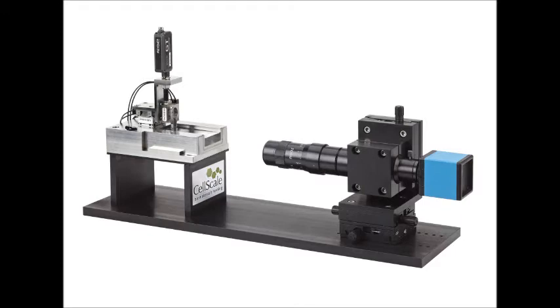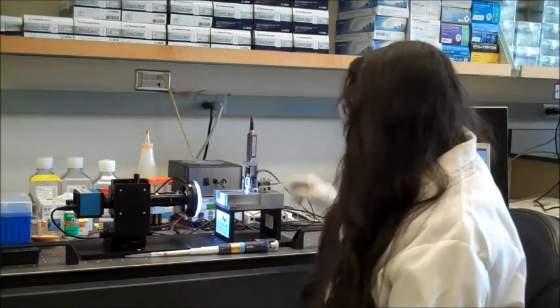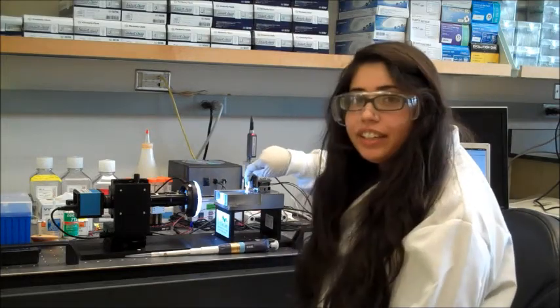I know a lot of researchers do different things with the micro squisher, so I wondered if you could just walk us through a typical test setup for your application. The procedure for setting up the micro squisher for our testing is very simple. Because the micro squisher relies on cantilever mechanics, the first step is to load a cantilever beam into the grip seen here.